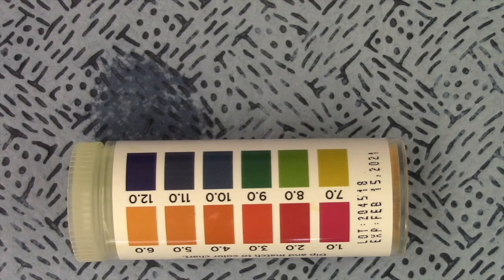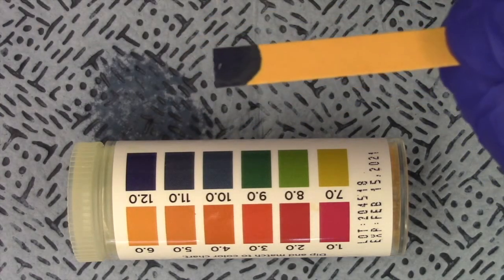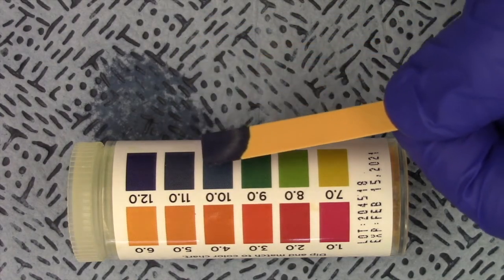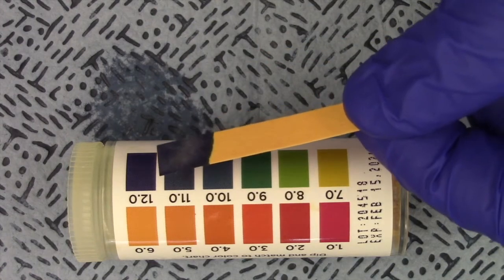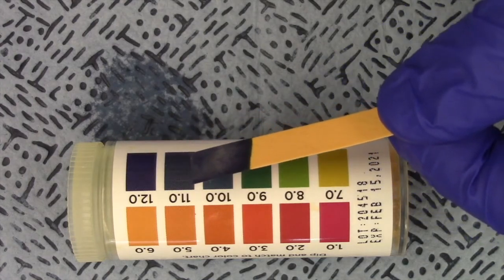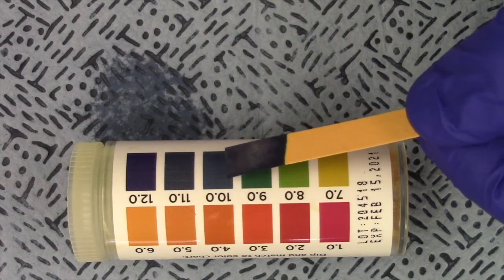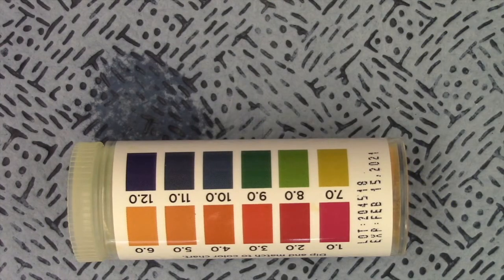So next up is a buffer. If you don't know what a buffer is, make sure you review the manual because we're going to need to know that for part 2. All right, here we go. There's our buffer. Again, it's kind of a dark bluish color. Make your own determination of what color you think that is. Which one do you think it matches up with the most or the best? That was the buffer solution.